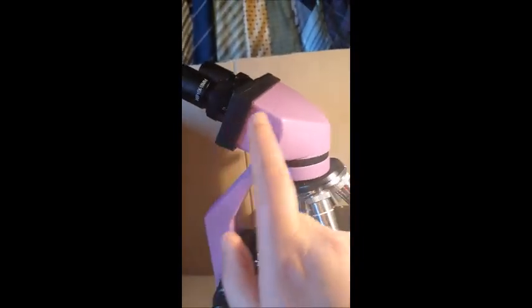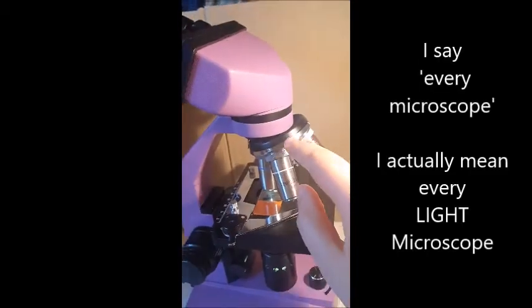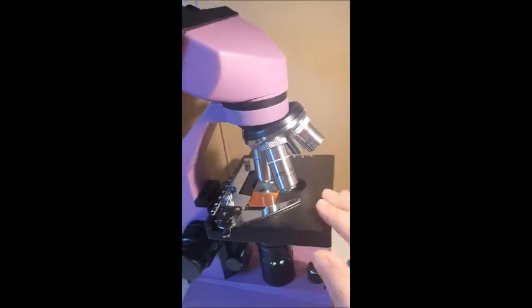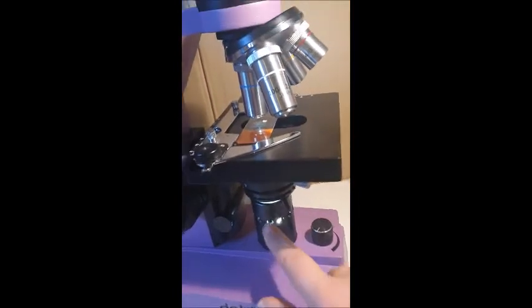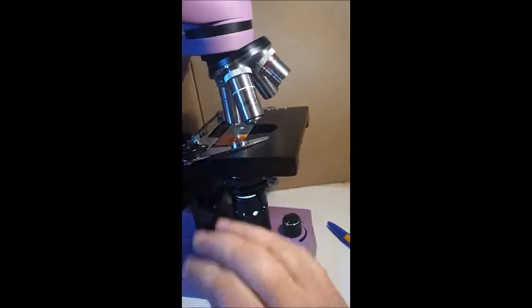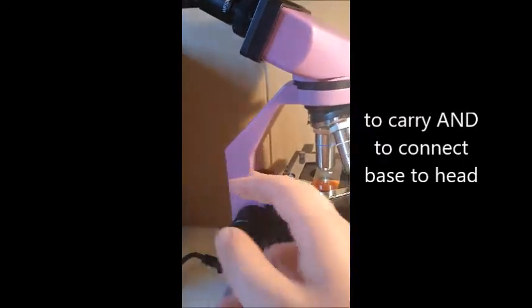So every microscope has an eyepiece. Every microscope has a head or barrel. Every microscope has this nose piece. Every microscope has objective lenses. Every microscope has a stage. They all have coarse and fine focuses. They all have a base. They all have a lamp. If they don't have a lamp attached to it, they might have a mirror, and then you put a lamp here that shines onto the mirror and then goes up. And they all have an arm that you carry it with.